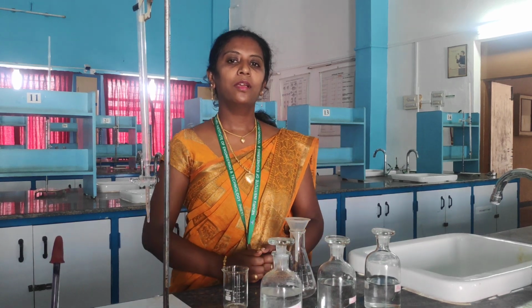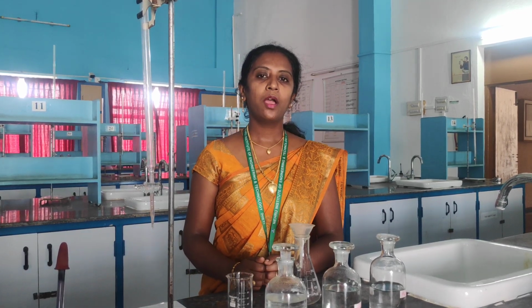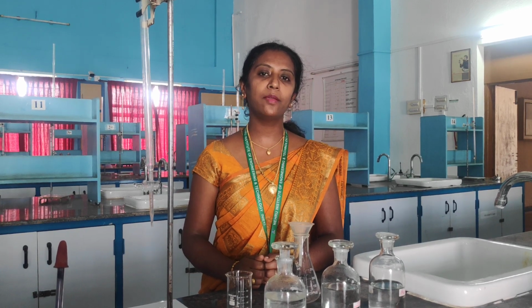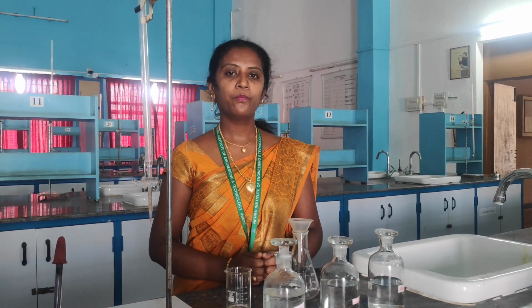Good morning all. I am Jenisha, working as an assistant professor, Department of Science and Humanities, Nehru Institute of Engineering and Technology. In this video, we are going to show a demo of a single experiment, named estimation of total, temporary and permanent hardness of water sample. This is the experiment we are going to see in this video.